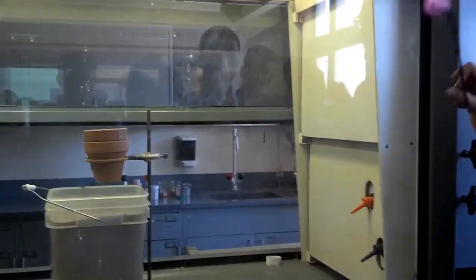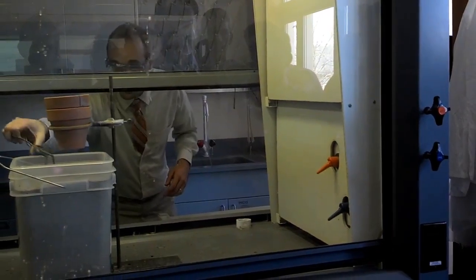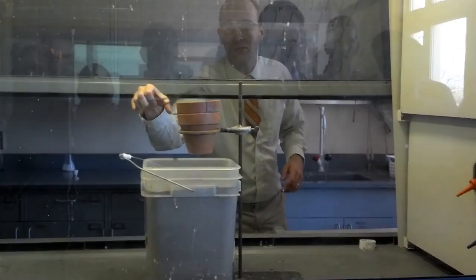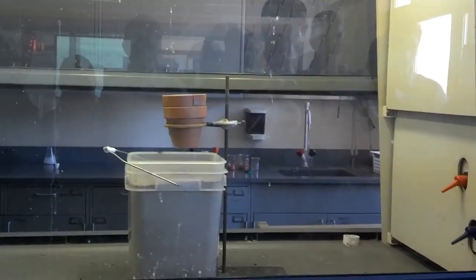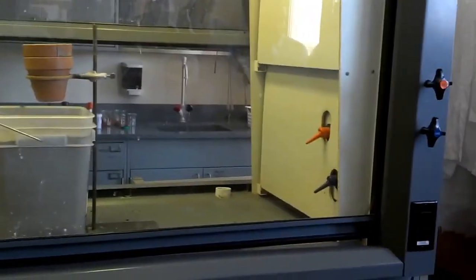Cool stuff. Yeah, so we'll crack this egg open tomorrow and you guys can see what it looks like. I'll show you the one from this morning. And yeah, it does crack the flower pot every single time. Materials can't handle really rapid delta Ts without some thermal instability.